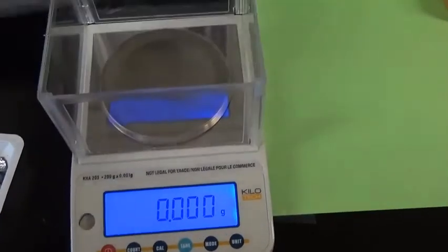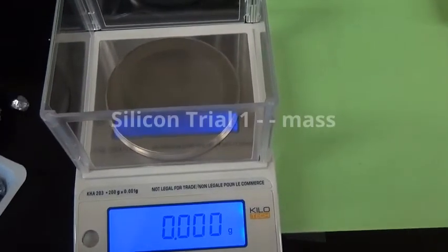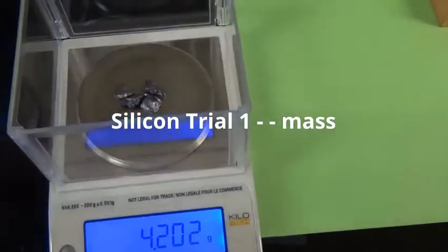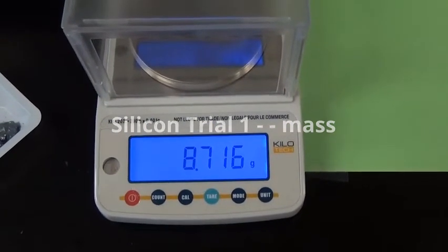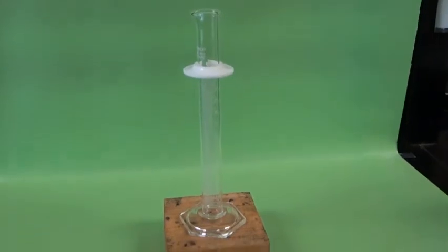Alright. Now we're going to put in some of these metal samples, excuse me, some of these silicon samples. They're not metals, they are metalloids. We're going to put those four in. And those four mass 8.716. Now we're going to use this graduated cylinder setup right here, and we're going to fill that with some water and then determine that.